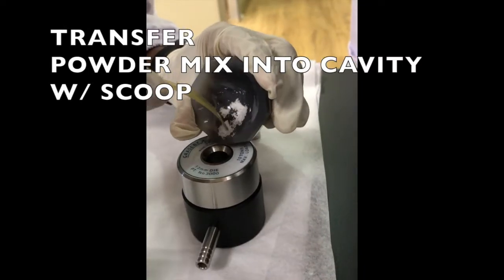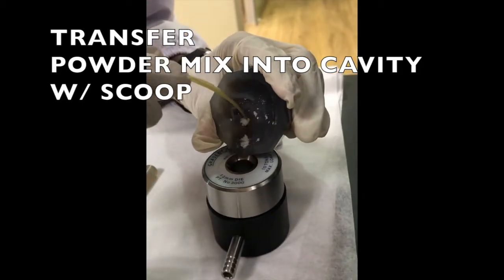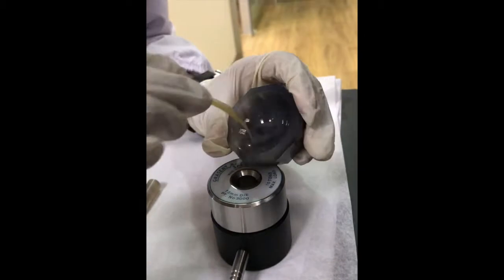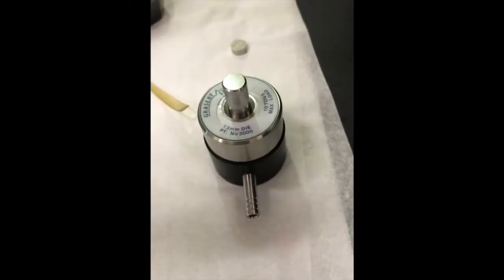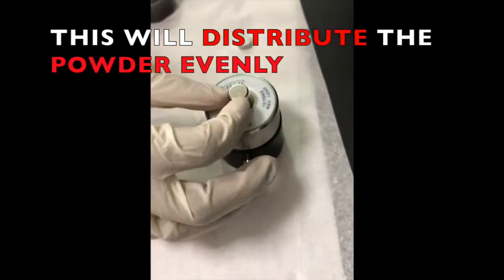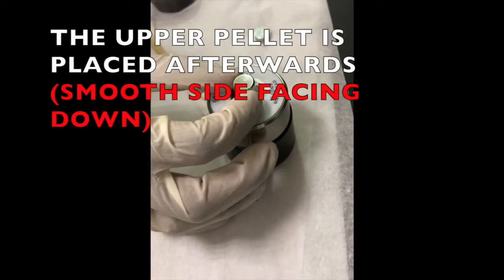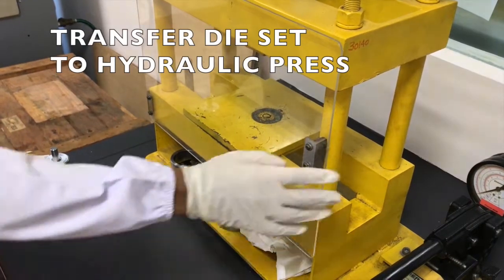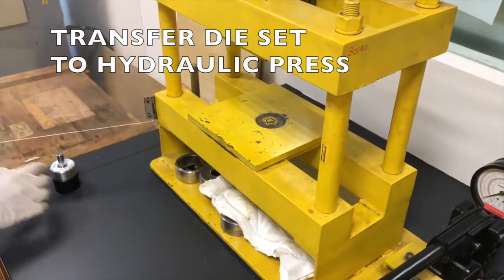Carefully transfer all the powder into the cavity using the scoop. Slide the bolt press into the cavity and rotate it to distribute the powder evenly. After this, push the upper pellet into the cavity with the smooth side facing down. Now transfer the die set into the hydraulic press.